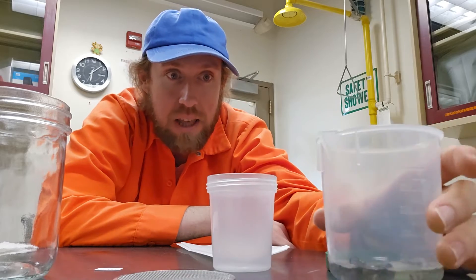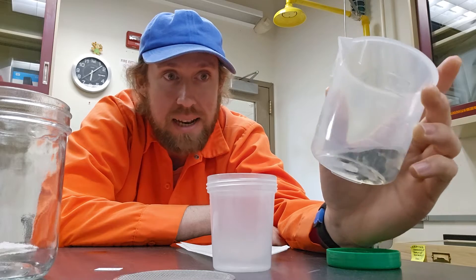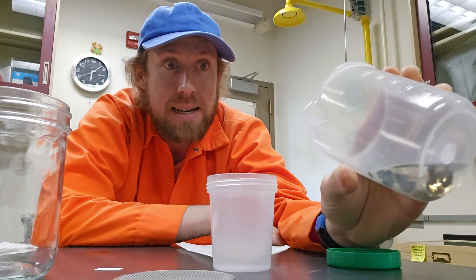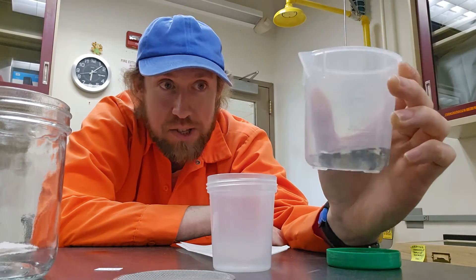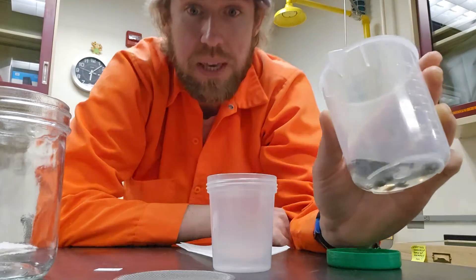So this new method cuts out the washing completely. What we have is specimens that are stored in alcohol — and this is assuming if they were mixed with other bees like from a trap, we've sorted them out to be just bees.